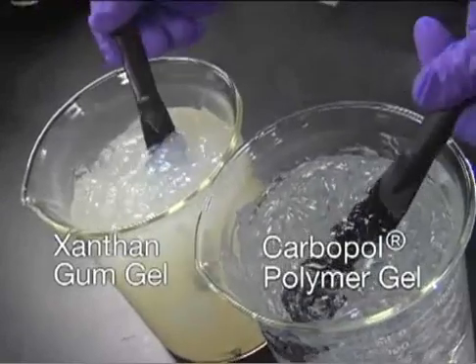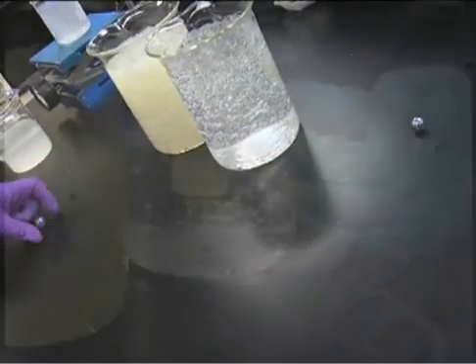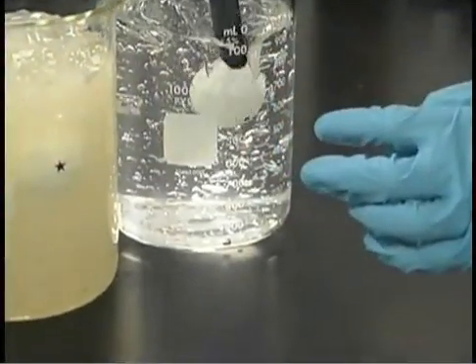The two gels have approximately the same viscosity. A dense stainless steel sphere, a glass marble, and a light plastic sphere are placed into each of the gels.